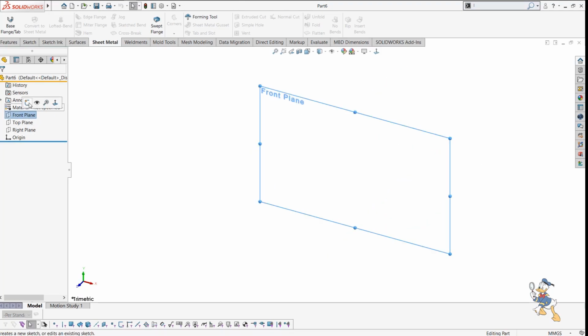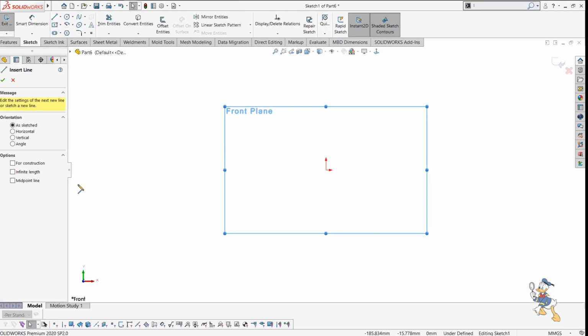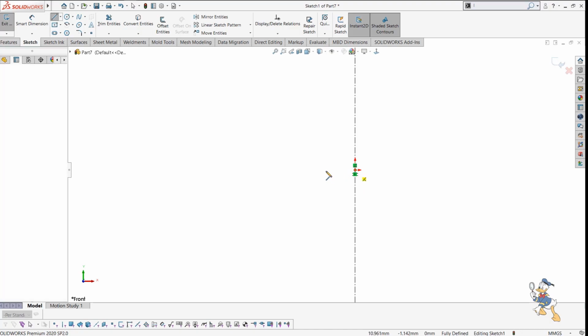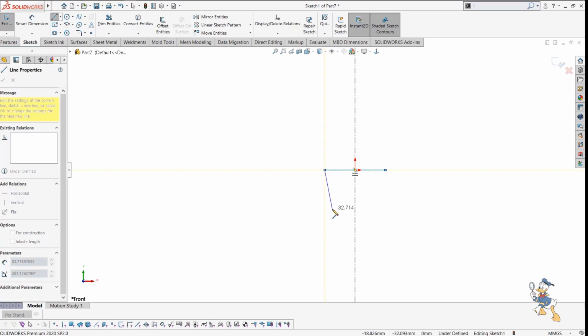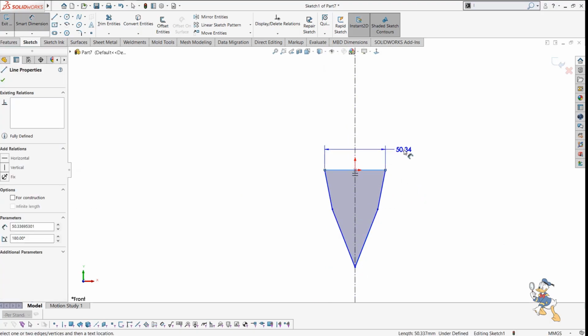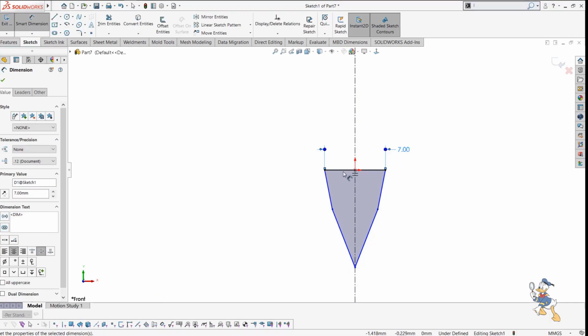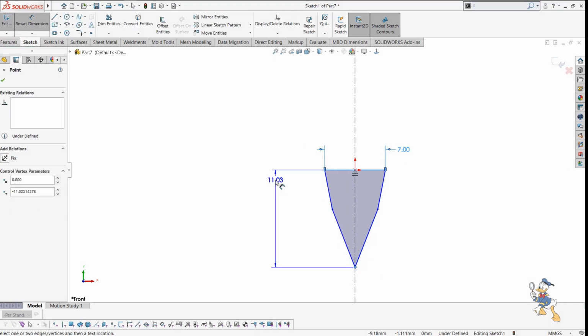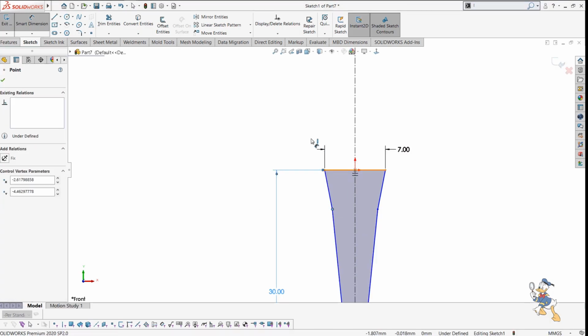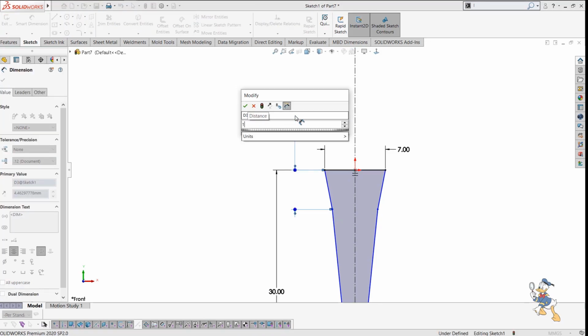Suppose we need to check it out over here. Suppose we need to generate a line again. Here, yeah, this one. It is very easy. I just need to generate some lines for this. Suppose this one, and this one. It automatically mirrors the whole feature for us. I just need to provide some distance, like it would be 30. It would be like 16.5.